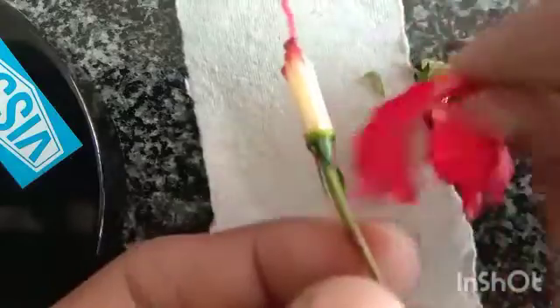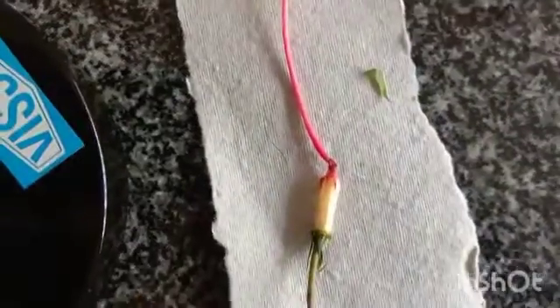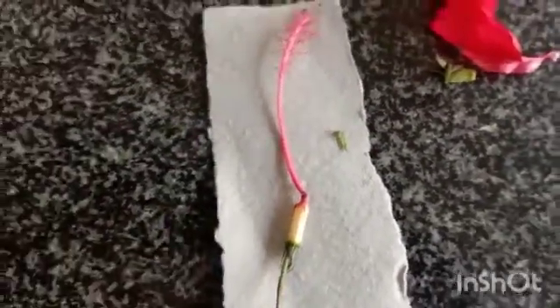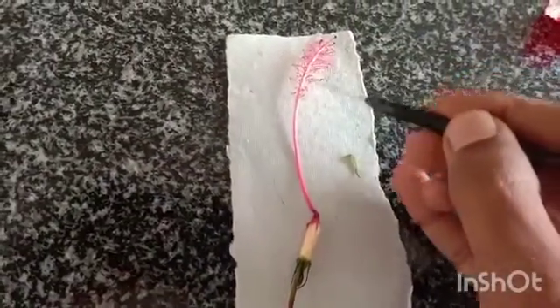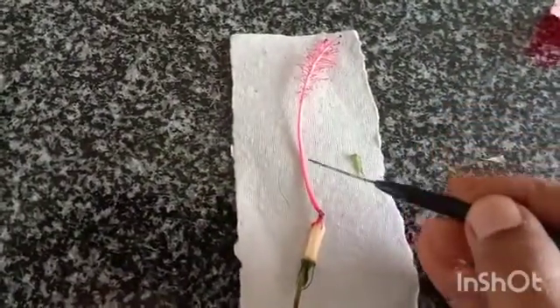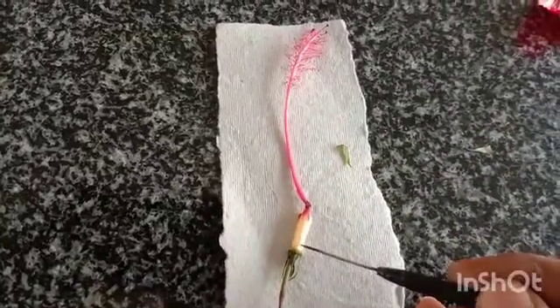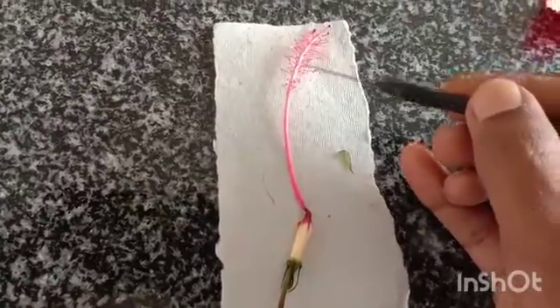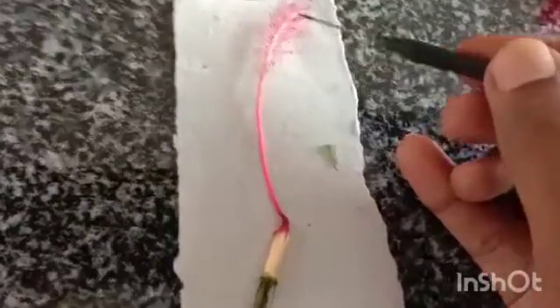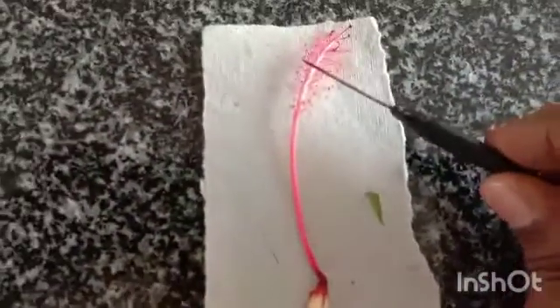Now we can see this. These are the male parts. You can see here. These are male parts.